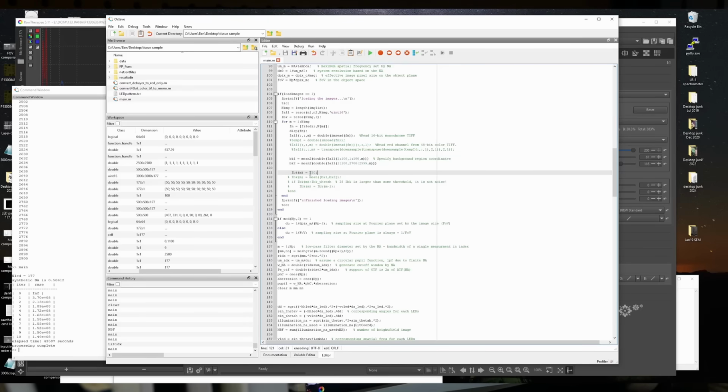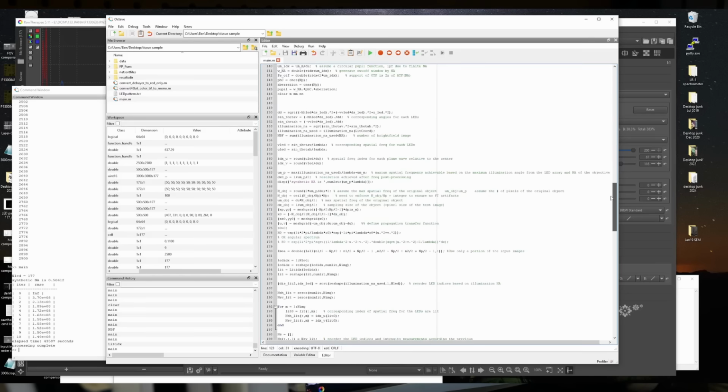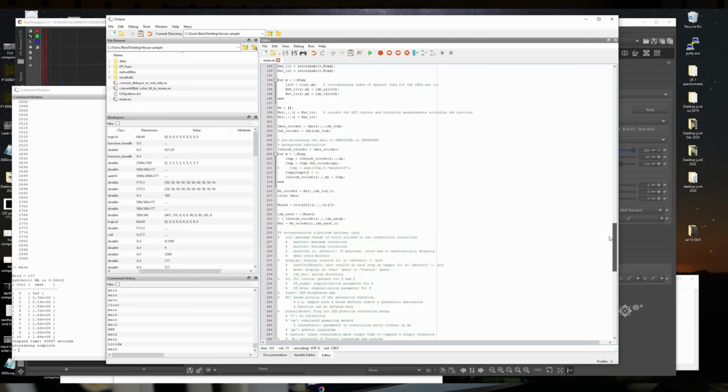You actually have to use the same illumination level for the center images as you do for the edge images. But again, I'm not exactly sure, and this is something that is left to the reader as an exercise.